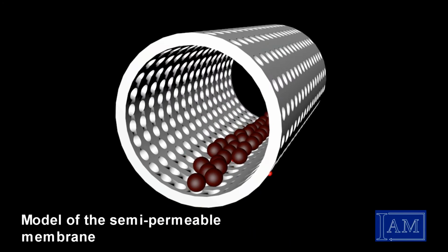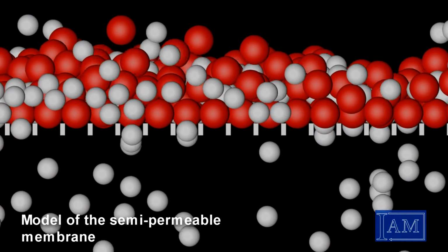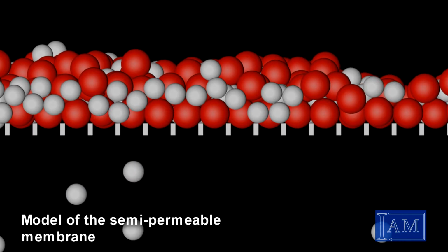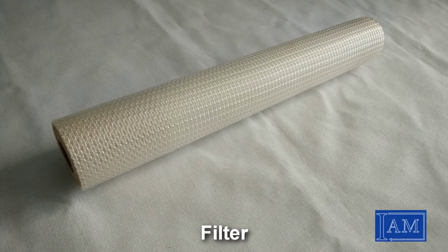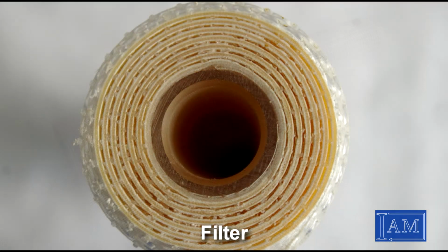I made a small animation about the semi-permeable membrane. As you can see, the smaller particles fall through the holes and the bigger particles stay in the same place. After a time, the pores or holes get clogged up, so we have to clear these filters. This is how a filter looks.